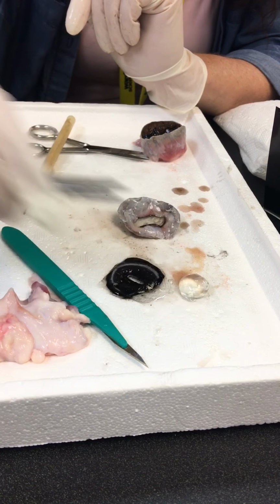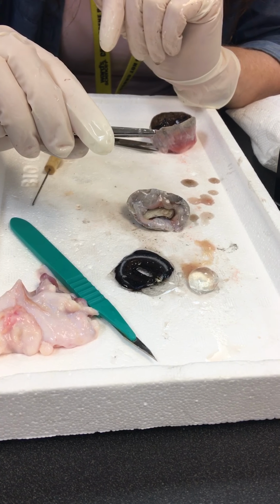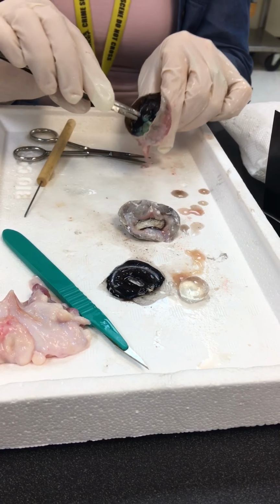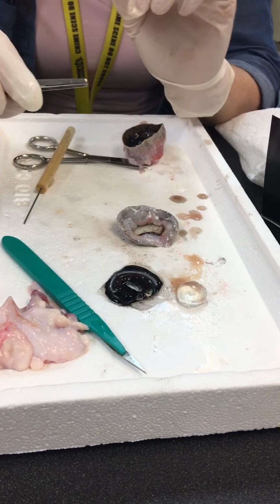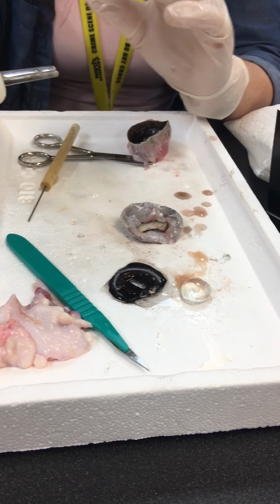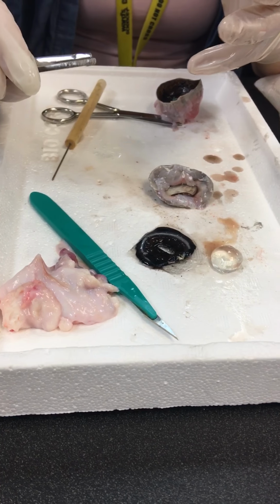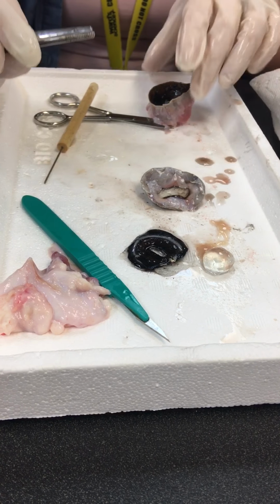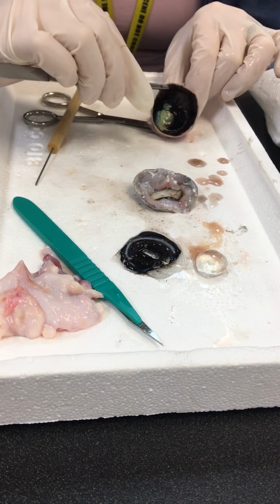So, did we cover everything on there yet? Did I miss anything? What is this? The tapetum? Okay, so the tapetum we talked about, but it's that iridescent portion. Now, that's not in humans, so those are only in nocturnal animals. So you might want to note that the tapetum is the iridescent reflecting layer, and it's only in nocturnal animals.